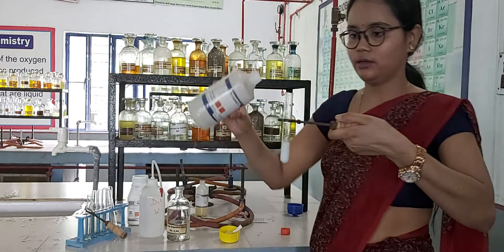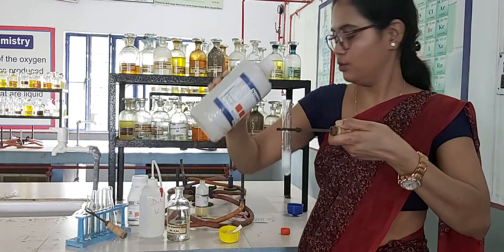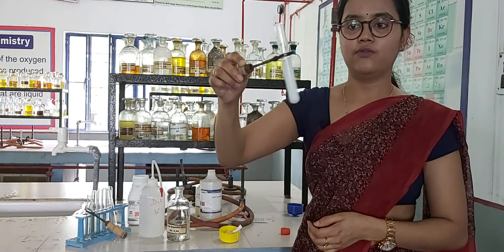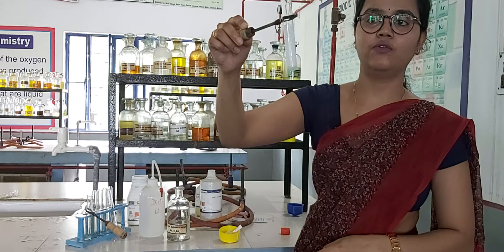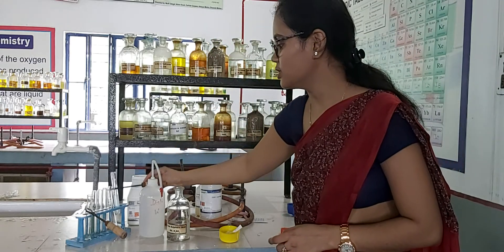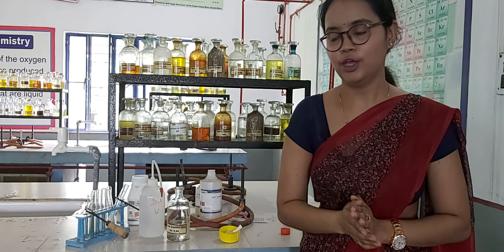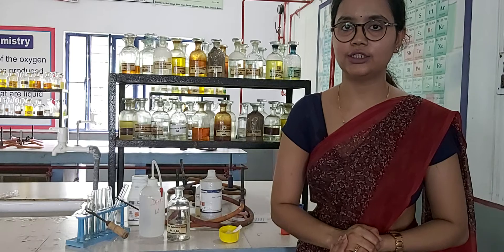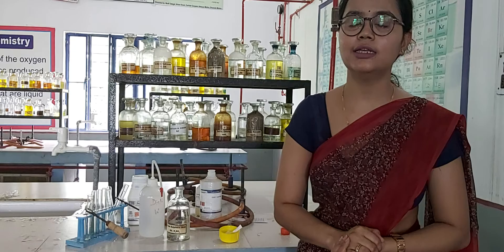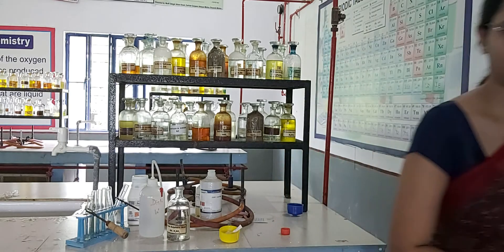For the confirmatory test, you will add lime water. Technically you should pass the gas through lime water, but here I am adding lime water directly. After adding lime water, you get a white precipitate, which confirms the presence of carbonate ion. So our cation is ammonium ion from zero group, and our anion is carbonate ion from the first group. Thank you.